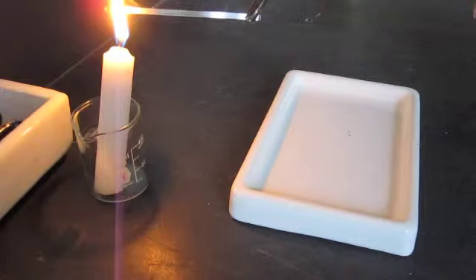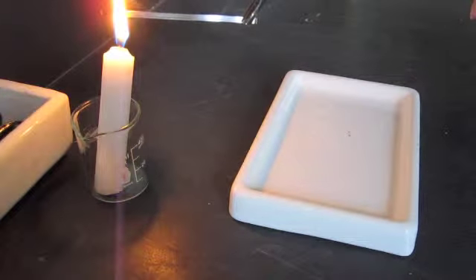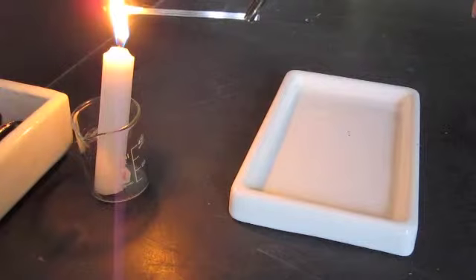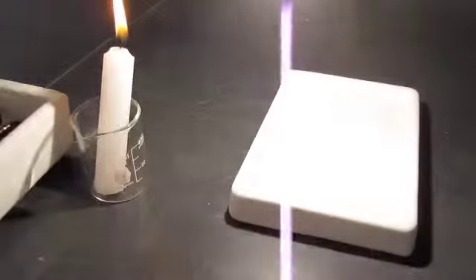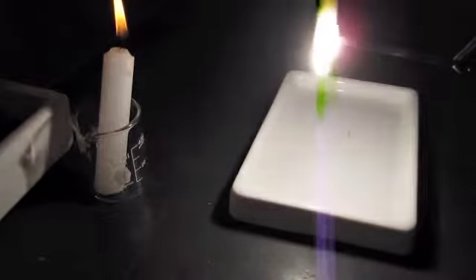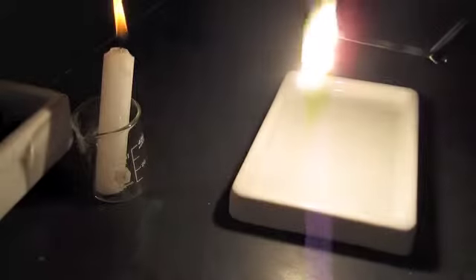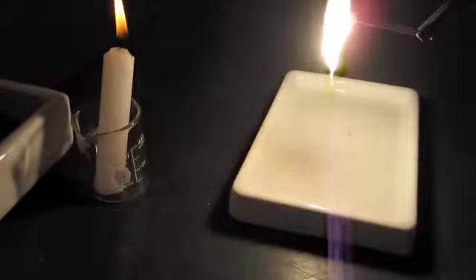In a moment or two. So this reaction produces a great amount of heat and light. So you can see this is evidence of a chemical change.